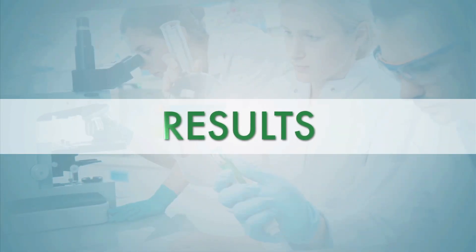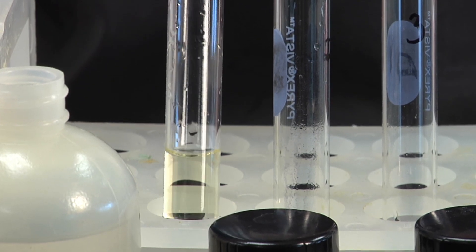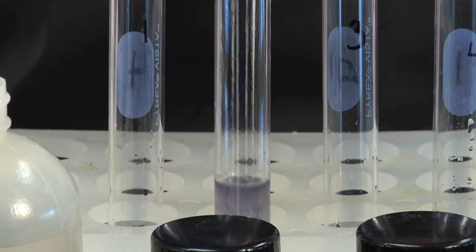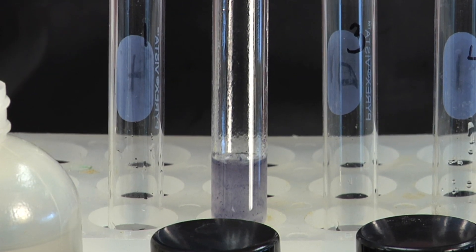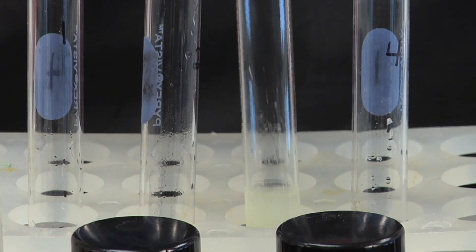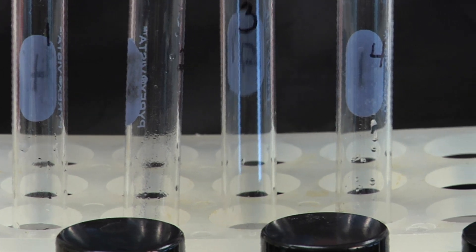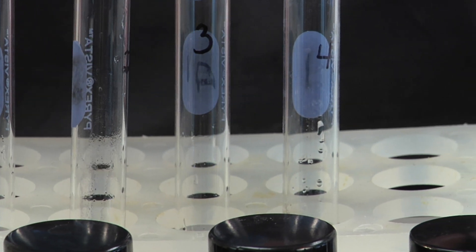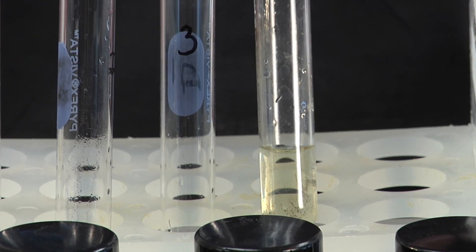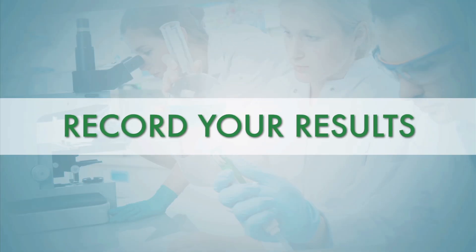Test tube one, which contains DI water, is light yellow in color, indicating a negative result for starch. Test tube two, which contains 1% starch solution, is light purple in color, indicating a positive result for starch. Test tube three, which contains onion juice, is light yellow in color, indicating a negative result for starch. Test tube four, which contains 1% sucrose solution, is also light yellow, indicating a negative result for starch.